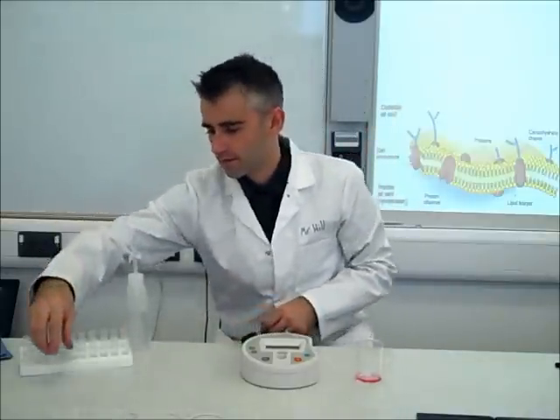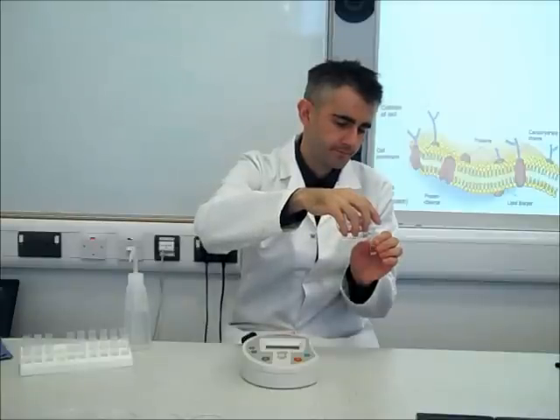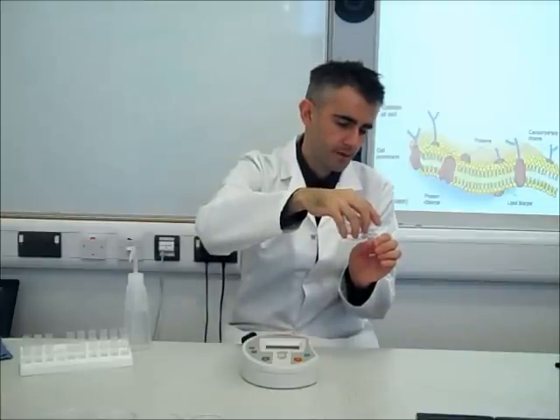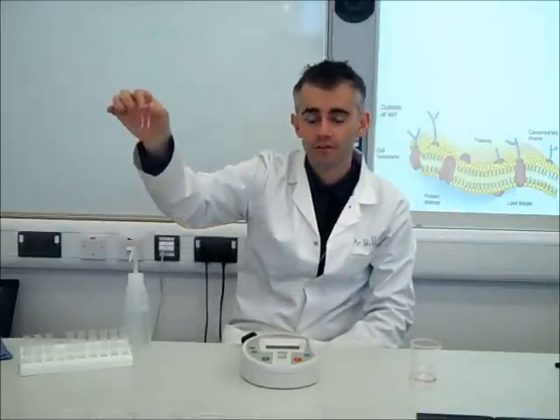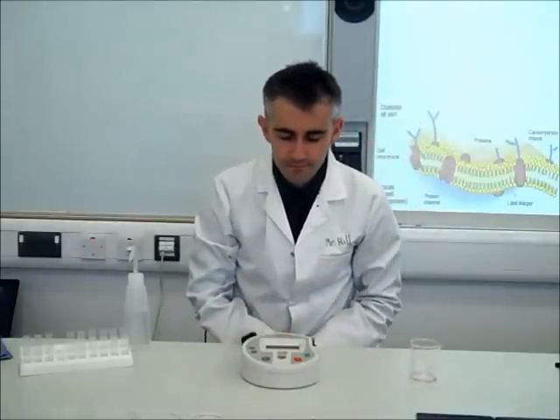I'll remove the reference cuvette and top it up with the solution from the 50 degrees Celsius sample. You can see how red-pink the solution is from the pigment that has diffused out through the cell membrane. Placing that into the colorimeter and pressing T, we get a value of 0.29. So at 50 degrees Celsius, after 20 minutes in 5 centimetres cubed of distilled water, the absorption of the pigment is 0.29. We'll compare this to the absorption values at other temperatures to see how temperature affects cell membrane permeability.